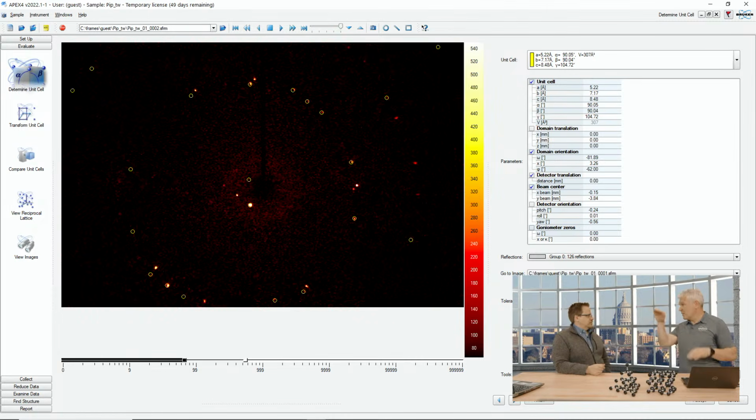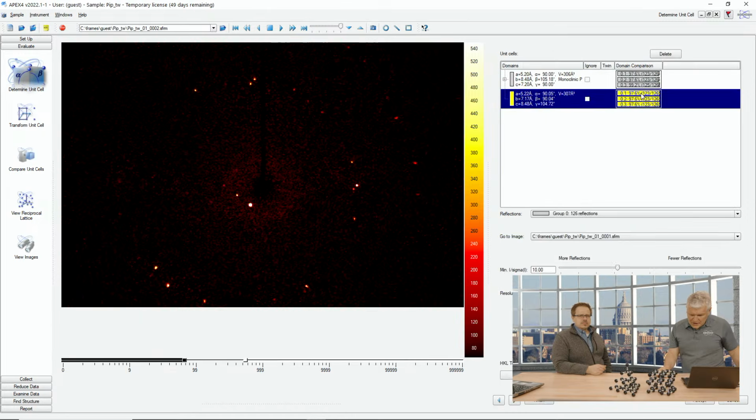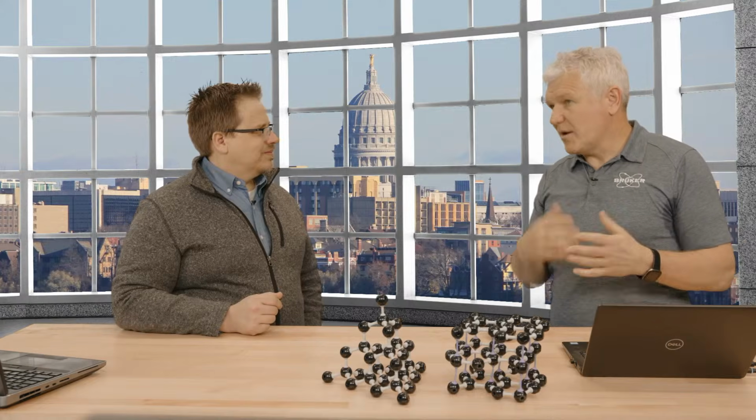You could have also used the zigzag patterns and a plane overlay tool to select those and then get your first domain and then get your second domain. And here we would do the same thing. We found one domain automatically now, and then we would do the same thing. Again, we say in the yellow, use the yellow unit cell, and again search in the green reflection bin, search for another domain, and it should do the same thing. There we go. So this is basically just the first step to being able to determine the unit cell.